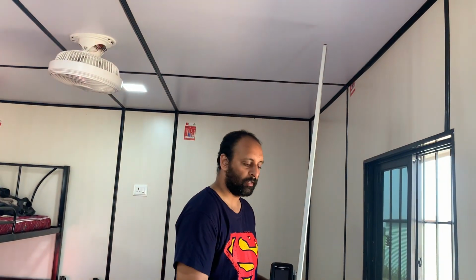Hi, so this video is about the working principle and how a PCA works. PCA is a plant canopy analyzer, and this is a PDA wherein we record the data from the plant canopy analyzer, and this is the plant canopy analyzer by itself.